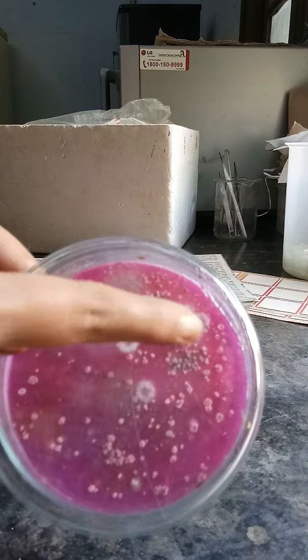First of all, we have to take a glass slide. You can see very nicely it is already clean and properly heated. On this slide we have to make a circle or round mark. This will be the middle portion of the glass slide where we want to make the mounting of the fungi, and that is to be done on the lower part of the slide.